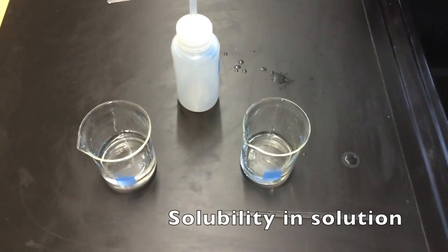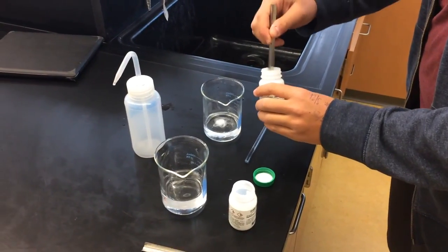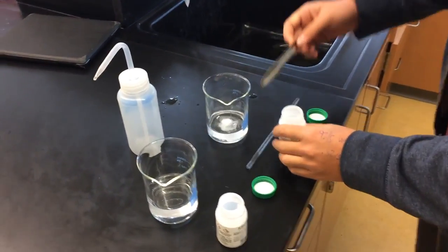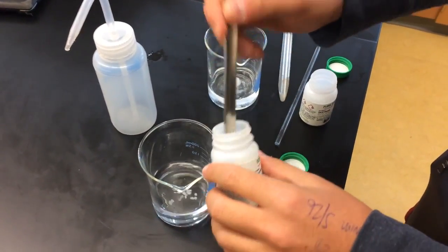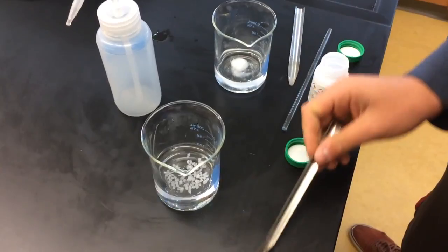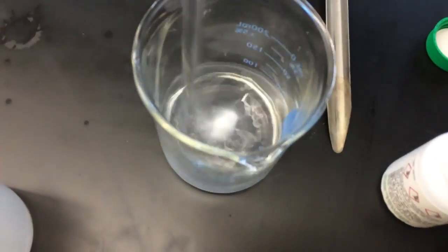To determine the solubility of a substance in solution, you will need a glass beaker, spatula, and a glass stirring rod. Simply place the substance into the desired solution, then stir for 30 seconds and note the contents of the beaker. If they have dissolved, your substance is soluble.